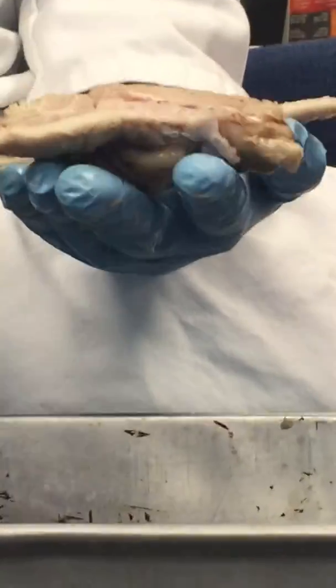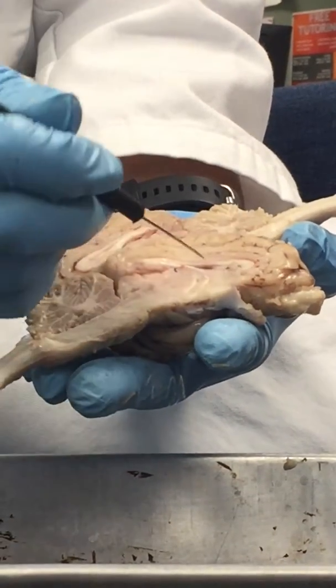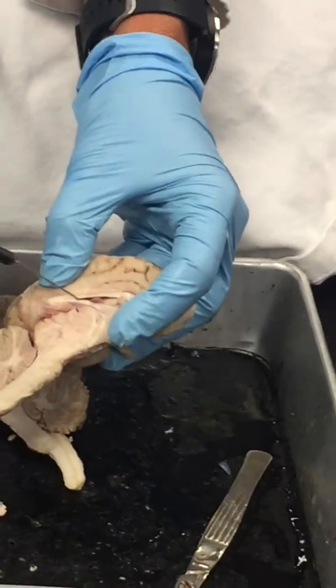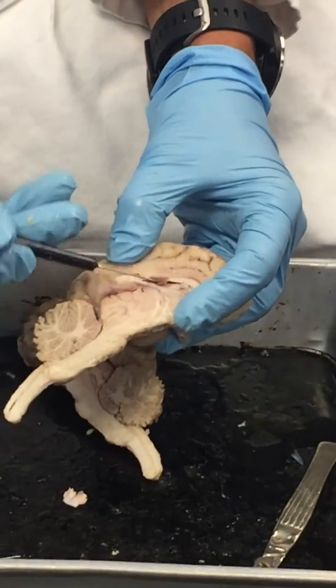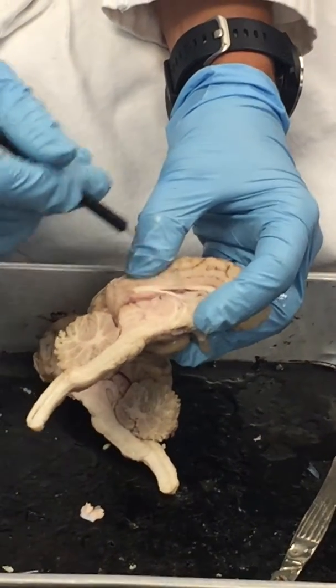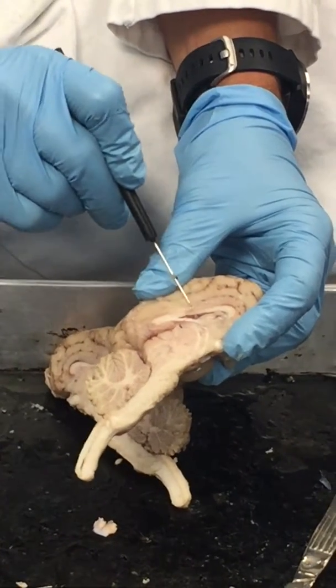If we look at a sagittal section, we're going to get a different angle of everything, right? As we look at it, this is a pretty good sagittal section. So we have this corpus callosum. This is that lateral ventricle right here. Okay, you can see the space filled with the choroid plexus, right? Right there, all of that stuff inside of that space. So here's the corpus callosum. Here, this white band down here is our fornix.